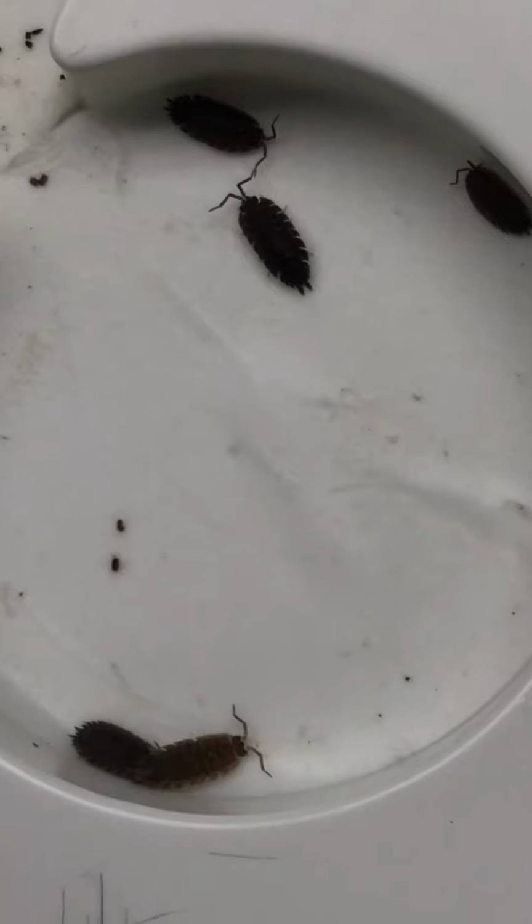All right, let's look on this side. So on this side, we've got our 6 that are just kind of hanging out. They really like being in that dark environment for sure. All right, so that concludes the isopod behavior light versus dark lab, or the data portion. So now you will need to analyze what you saw and compare that to things that you observed in the first experiment with the wet versus dry. Okay, please let me know if you have any questions, and hopefully you enjoyed this.